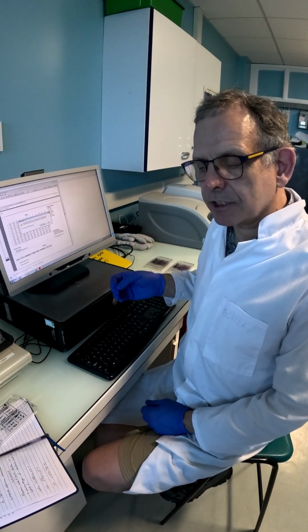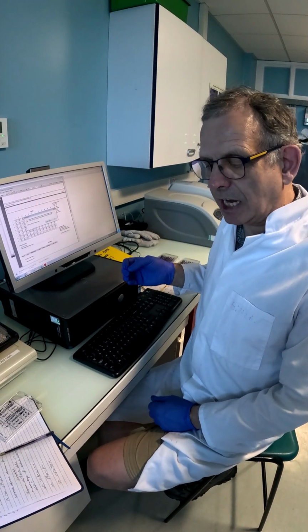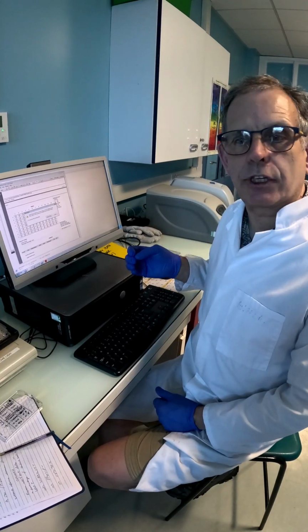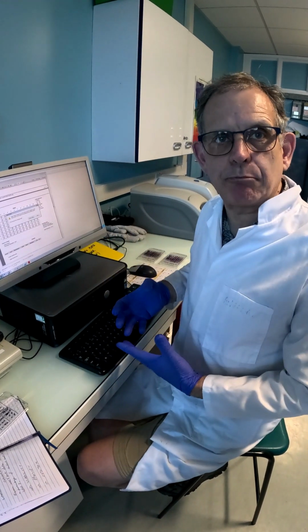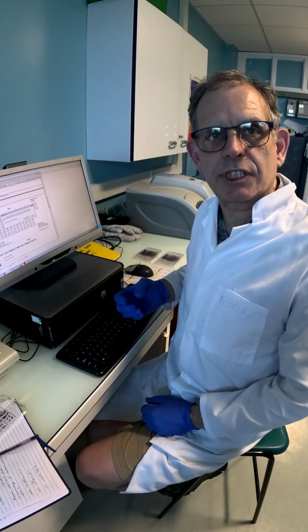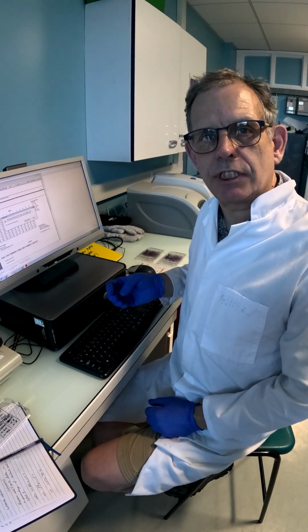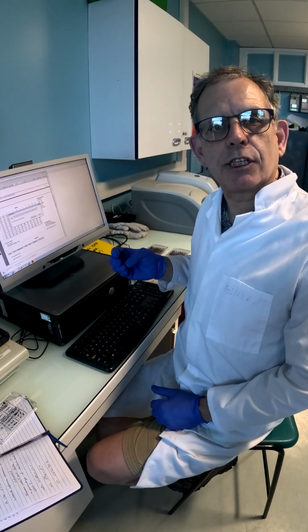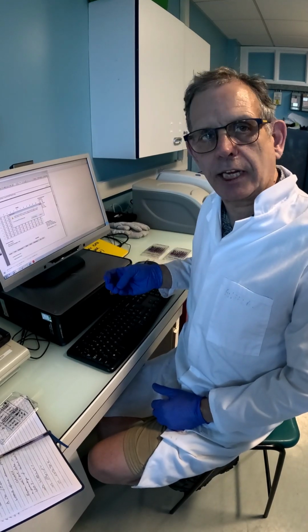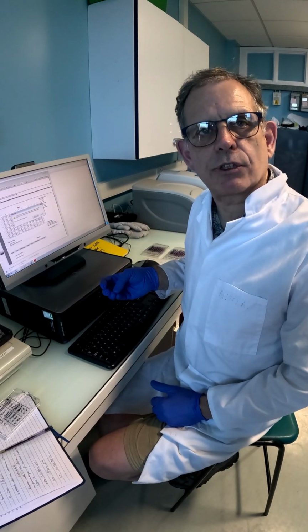Once we've done that, we express all these calculated test data as a percentage of the control unstimulated or untreated sample, which is set at 100%. From that, all data can be converted to percentages relevant to that control and can show quite clearly the effects on viability, proliferation and cytotoxicity.